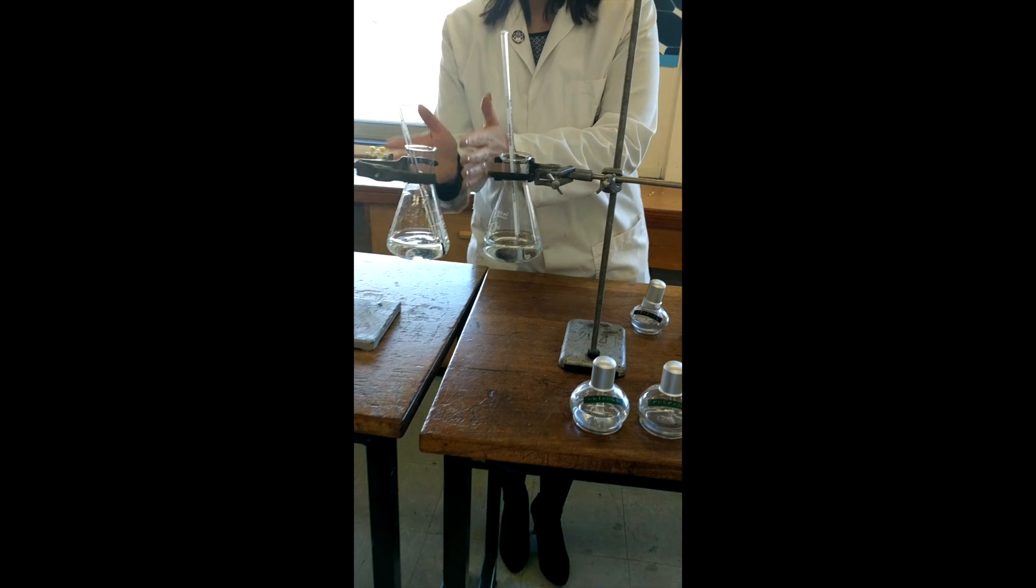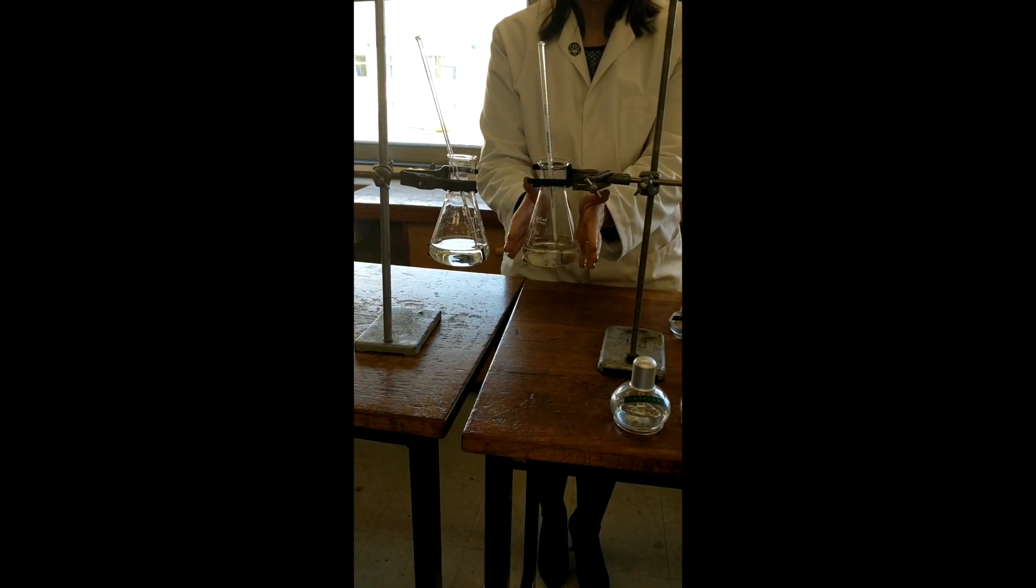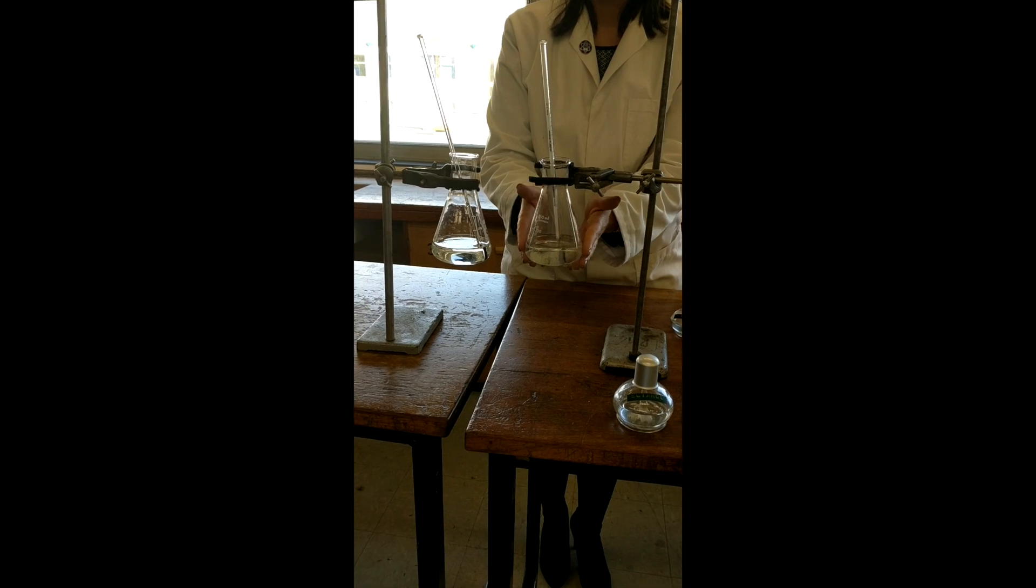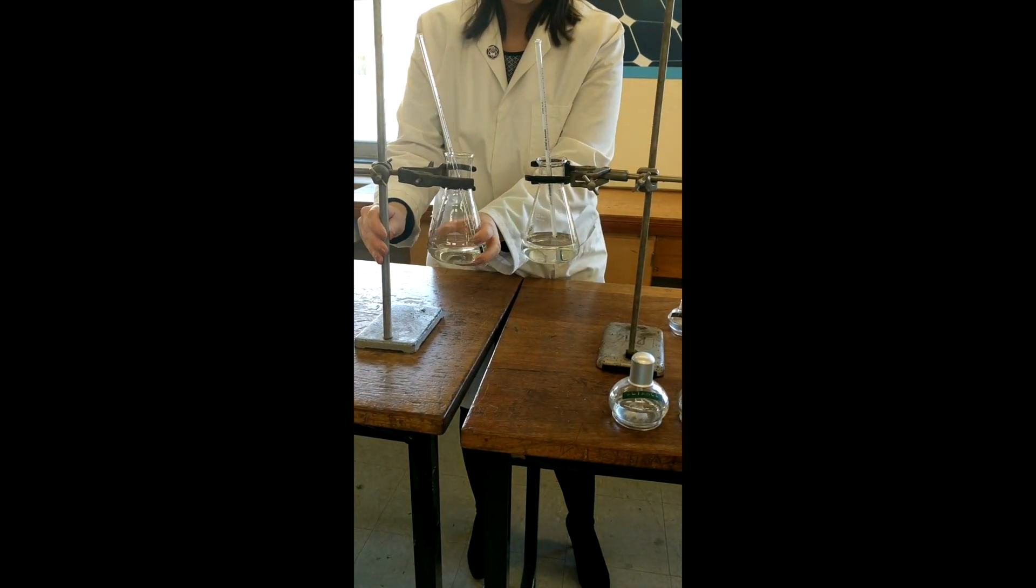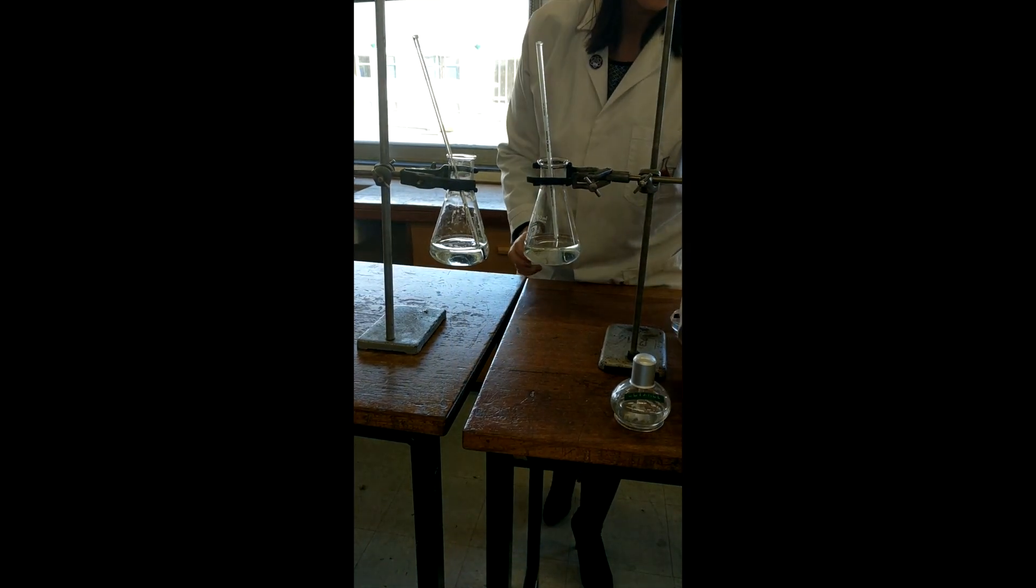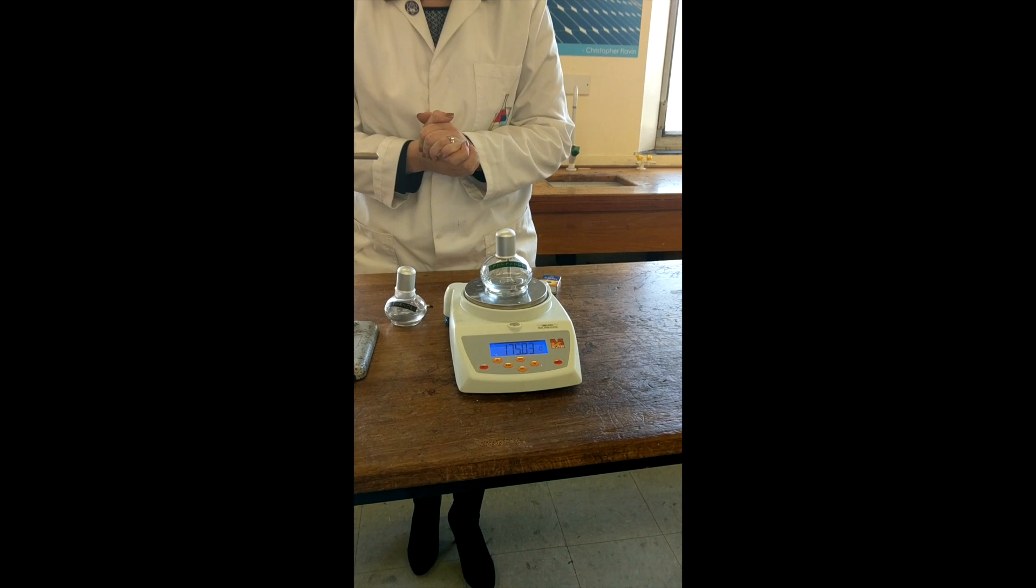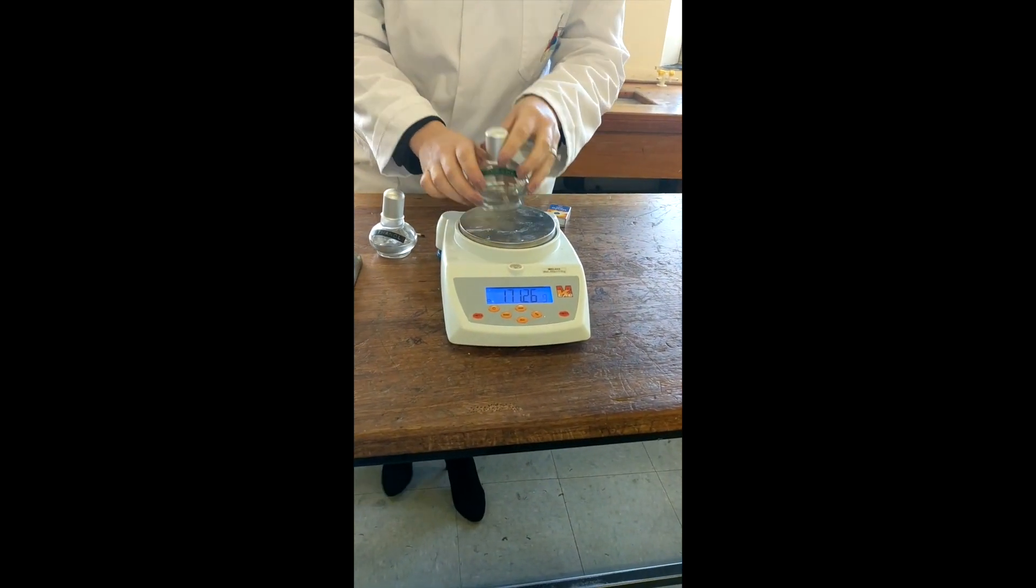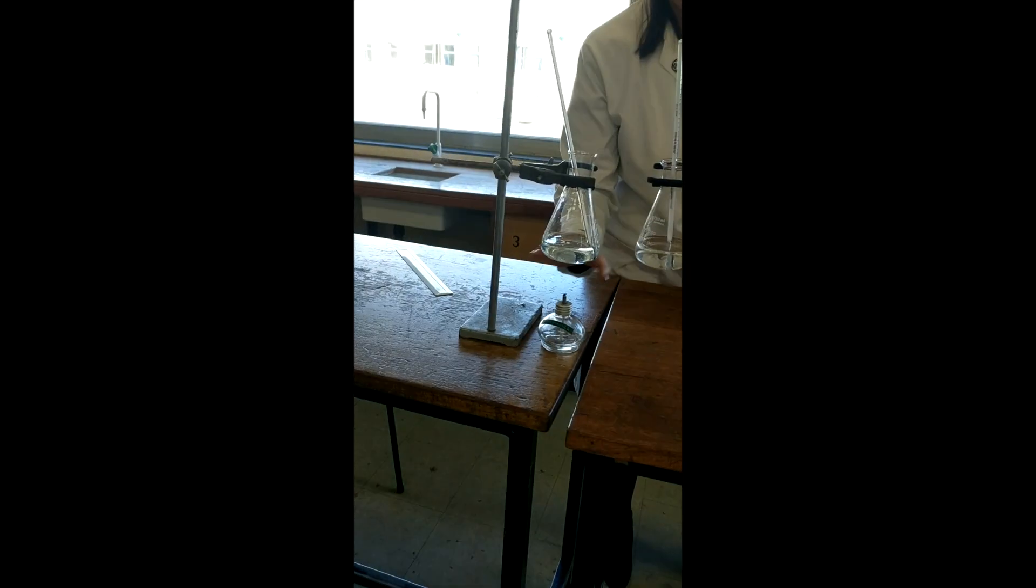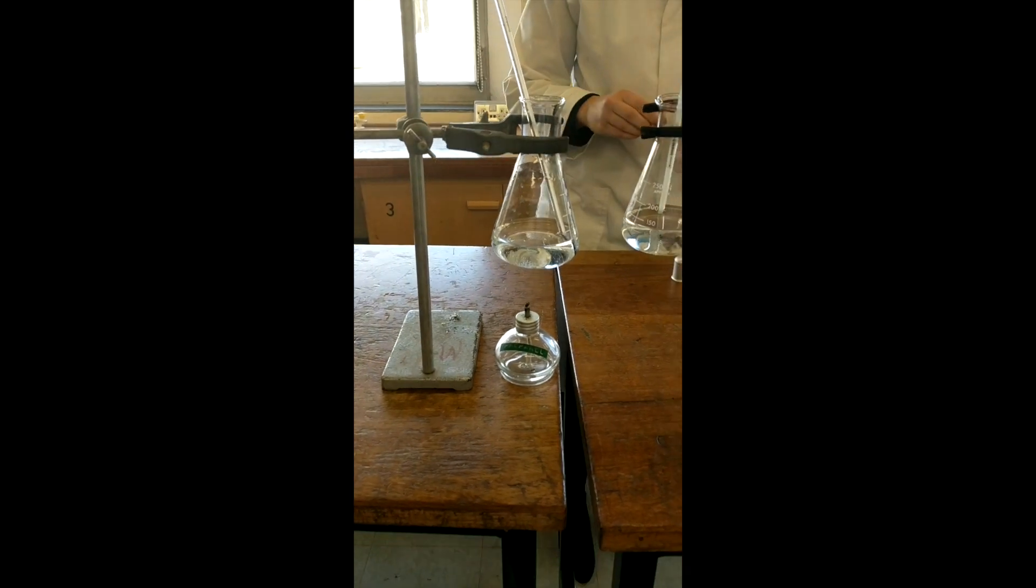You're then going to need to either get another conical flask with some fresh cold water in it or empty this out and refill it with some more cold water. I've got one here that we've already prepared. And you will get your next one, propanol. Again, you would weigh it at the start with the cap on.